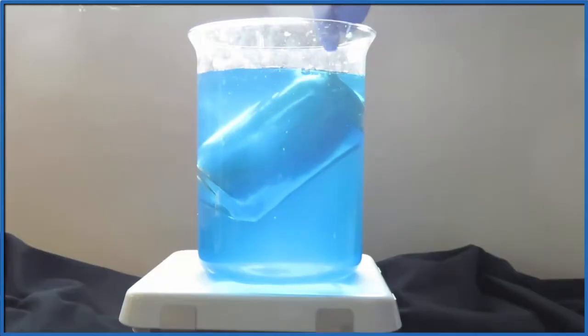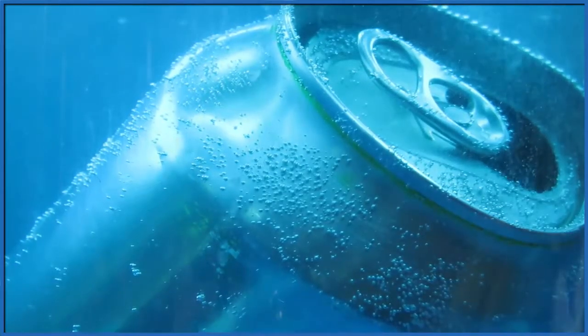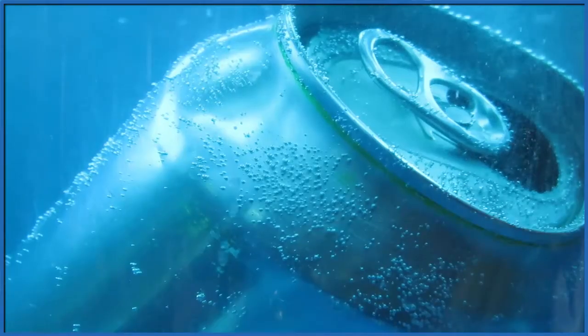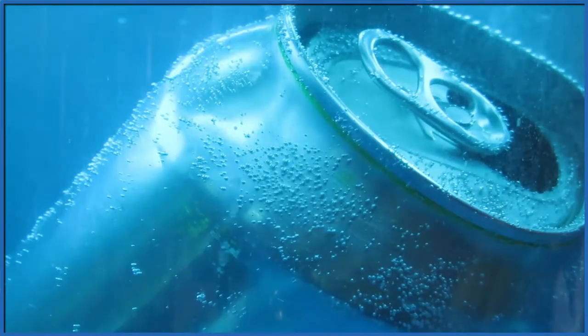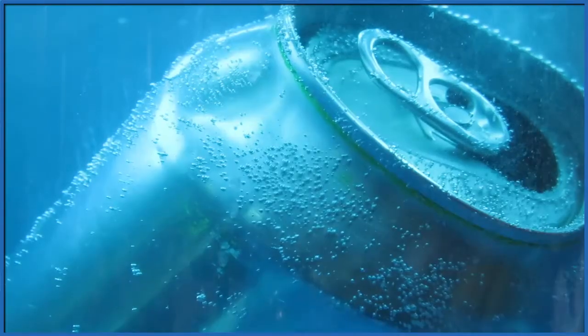If we kind of zoom in and look, we'll see bubbles forming. Bubbles, they're a sign of a chemical reaction. And if we wait just a little while, a dark substance will start forming on the surface of the aluminum can. That's the solid copper.